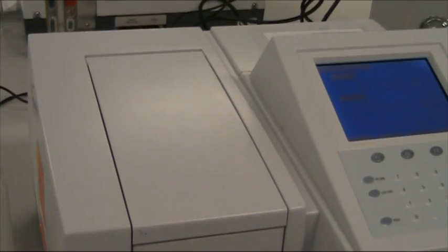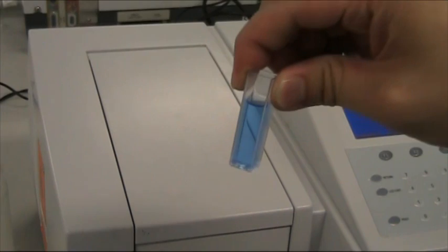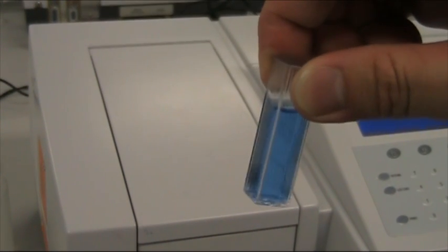Transfer the sample that you wish to measure into the cuvette. Insert the cuvette into the receptacle and ensure the lid is closed.